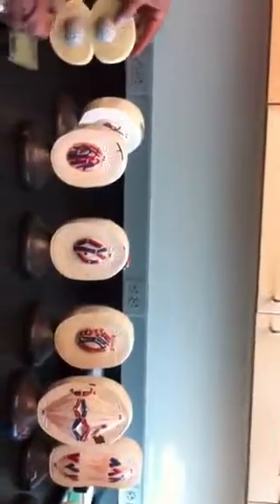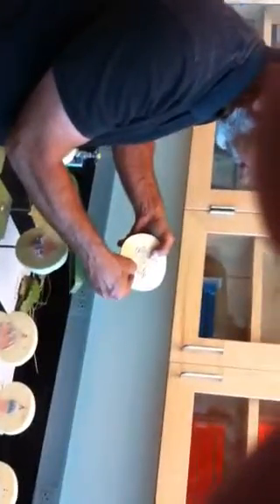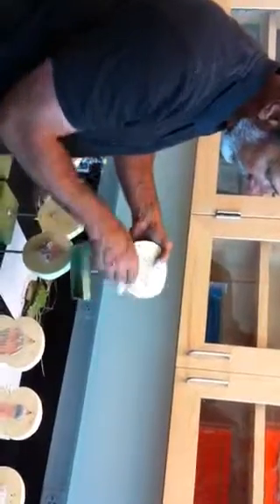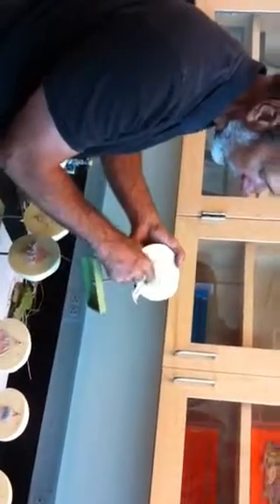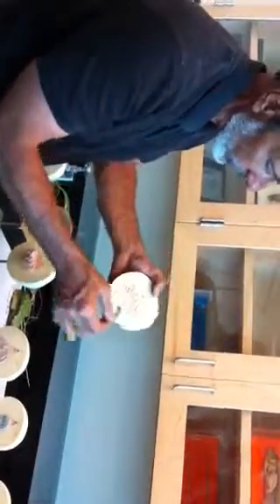Another thing I've done on the exam is I've put the pointer, let's say, here, and pointed to that little black dot. That is a centrosome. It's migrating to the poles. Another thing I've done is I put the pointer right on one of these little red lines. That is a kinetochore microtubule, connected to the chromosome, the chromatid as it's being separated.